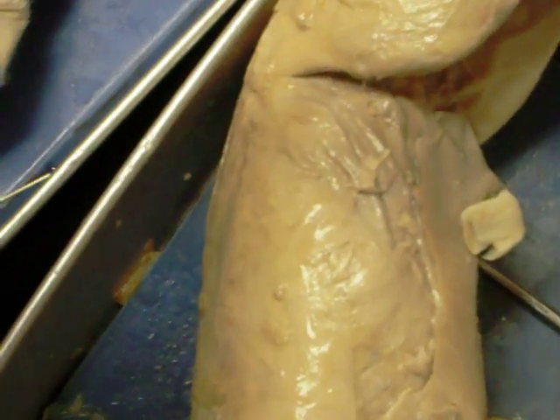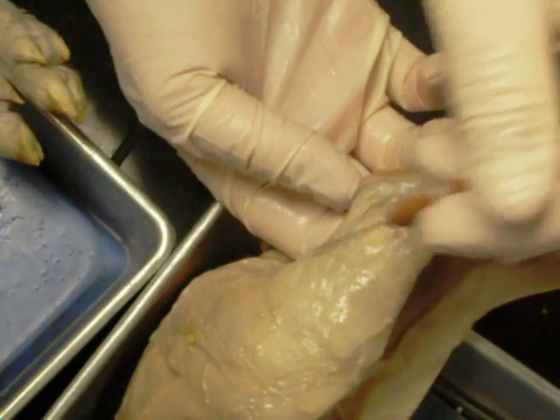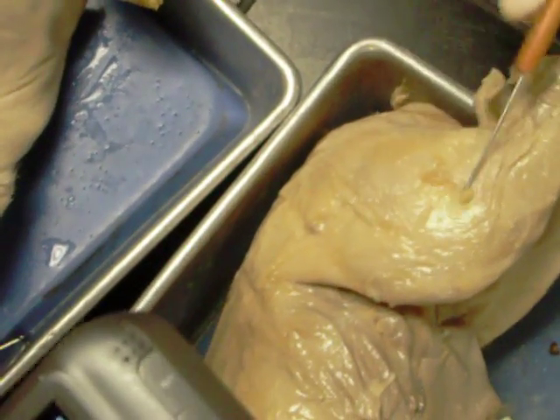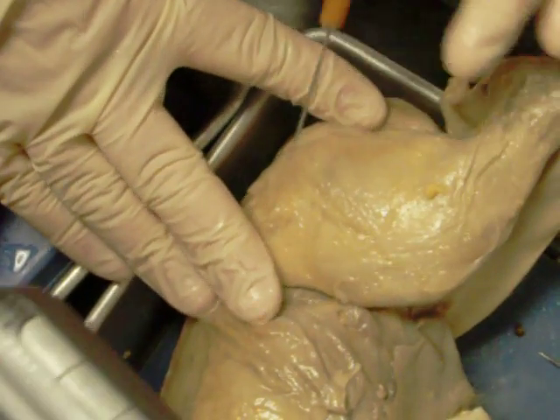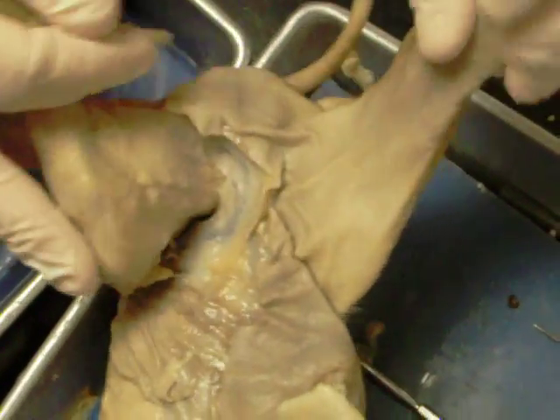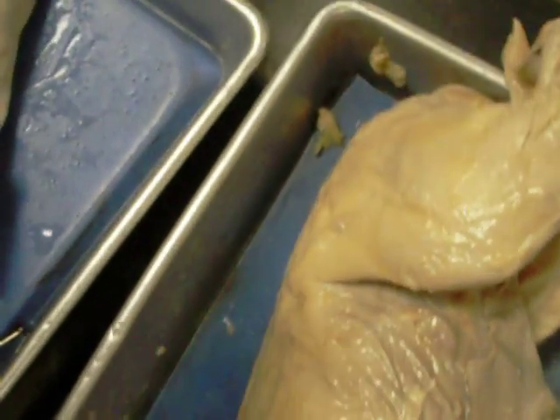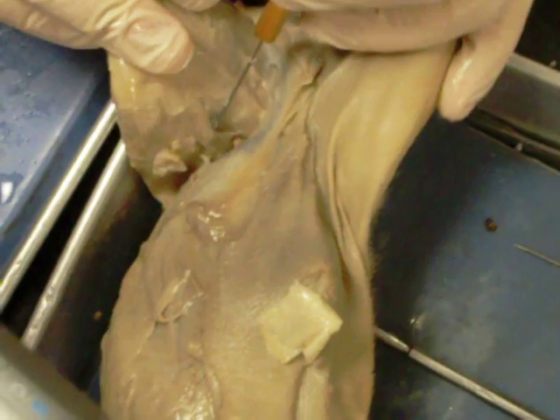Let's go ahead and look at the muscles. We're going to go over to the male pig because he's ripped. Starting posteriorly, we can see the gastrocnemius muscle right here. Here we have the biceps femoris — there's a layer over the top of it, but you can kind of see the fibers as they travel across the front of the leg. We have the sartorius muscle right there.